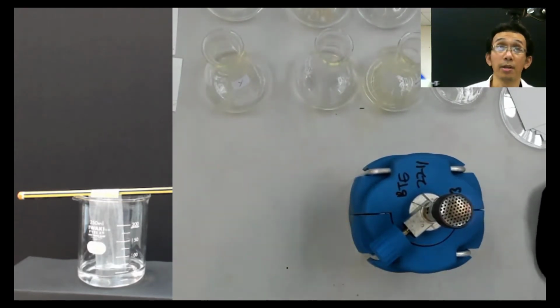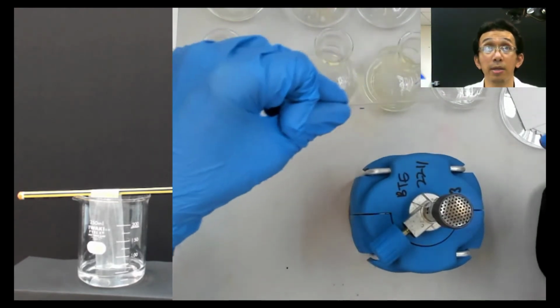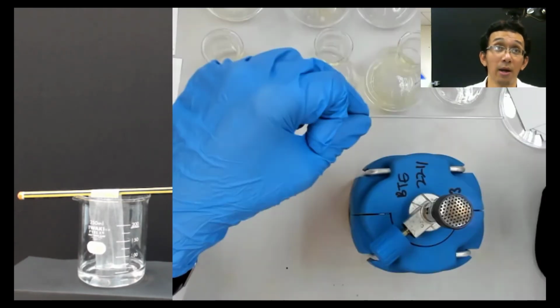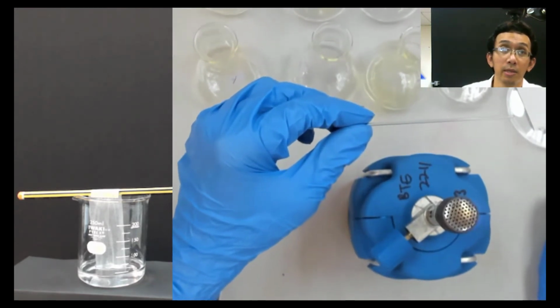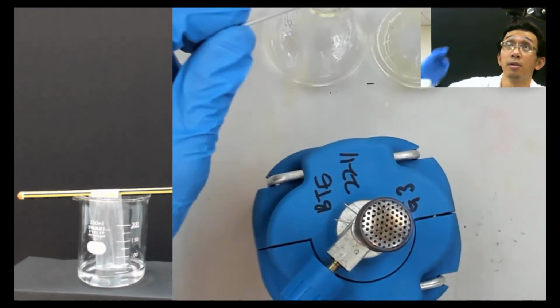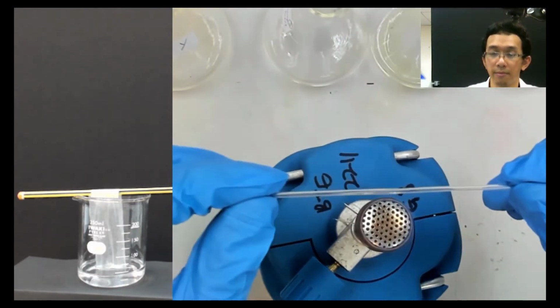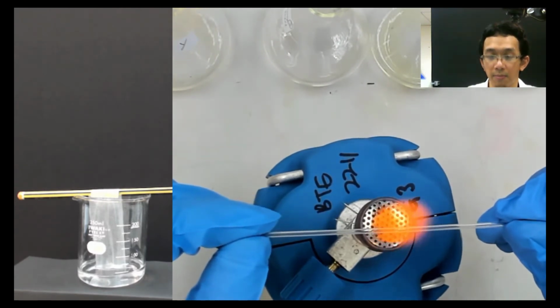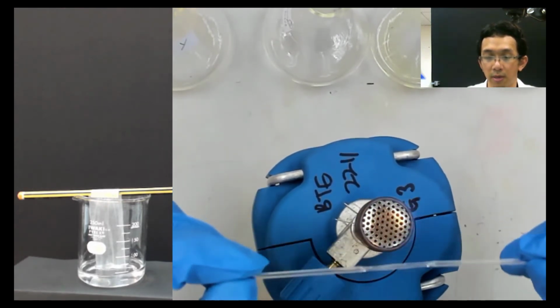So now we have this capillary tube. How you do it is basically you put the middle here. I will put the middle there, and then it will become saggy, and then you pull while doing that. Let me zoom a little bit so that you can see. Okay, still hot, so I need to be fast. I put it on top of that, and after you see it melting a little bit, bring it out, and then you pull.